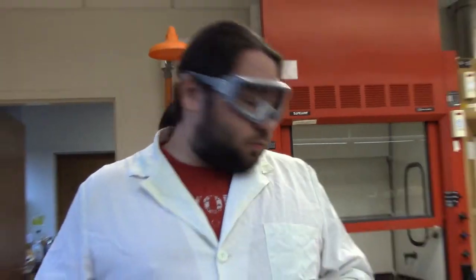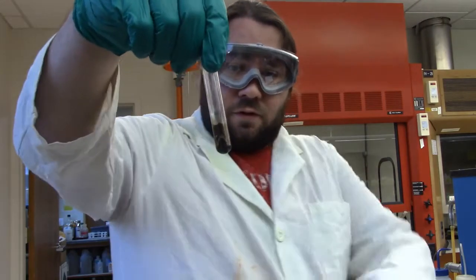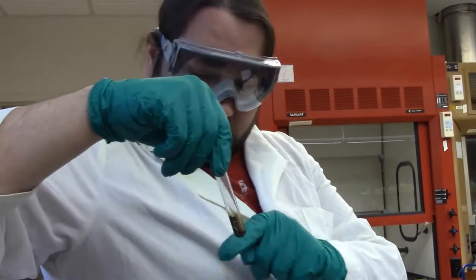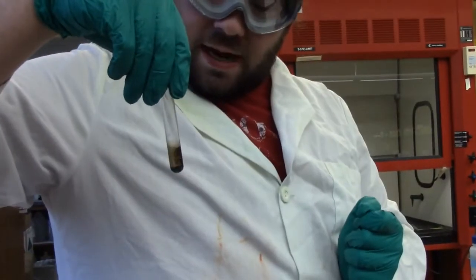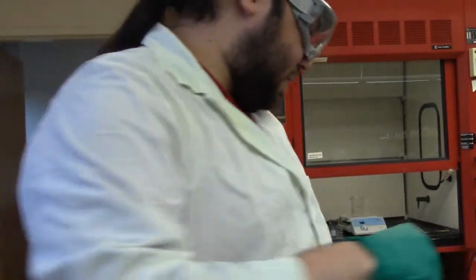Alright, so I've gone through the first few steps, and I've separated the group 2s, which are in our precipitate over here, and we kind of got that shiny, glassy look on the outside of it, but if you look really closely, you can see that our precipitate is mainly down there. I'll hold it up to my white shirt, if that helps. Sorry for the dirty lab coat this time. This is my personal lab coat. I wasn't able to borrow Professor French's because she's not here.